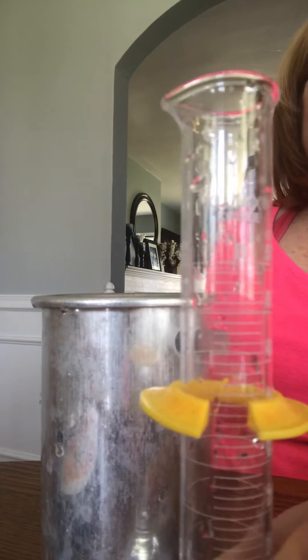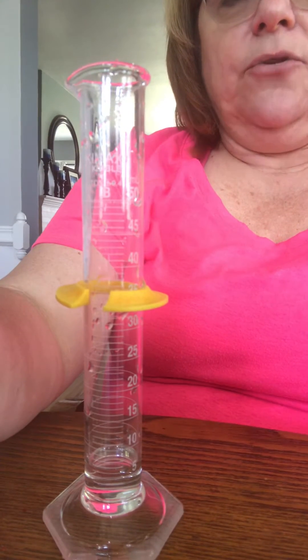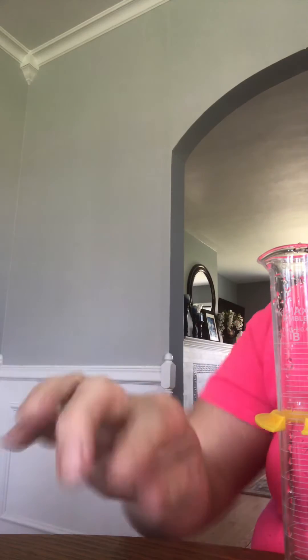I think it's done pouring. Now the problem with this graduated cylinder is that it is only measured in one milliliter. So when you record your answer, you can only put something in the ones place because your measuring instrument is not more accurate than that. When you look at this on a flat surface, you'll see that it's three milliliters. It's not 3.0 because the measuring instrument doesn't go to tenths, so it's only three milliliters.